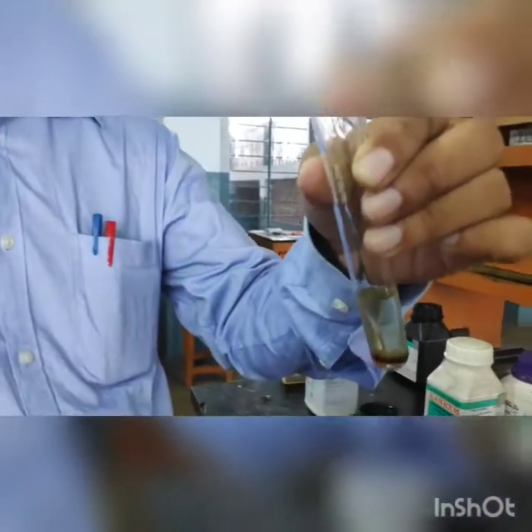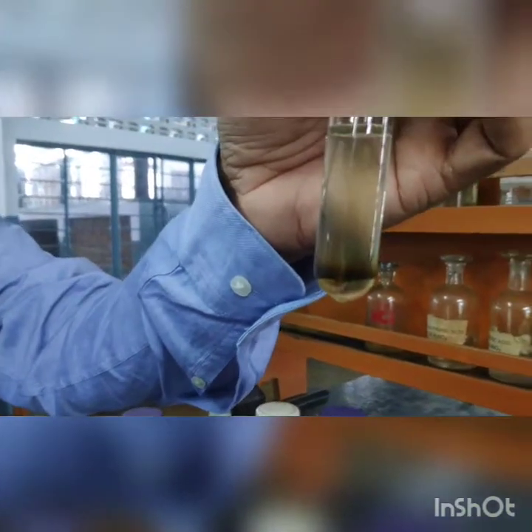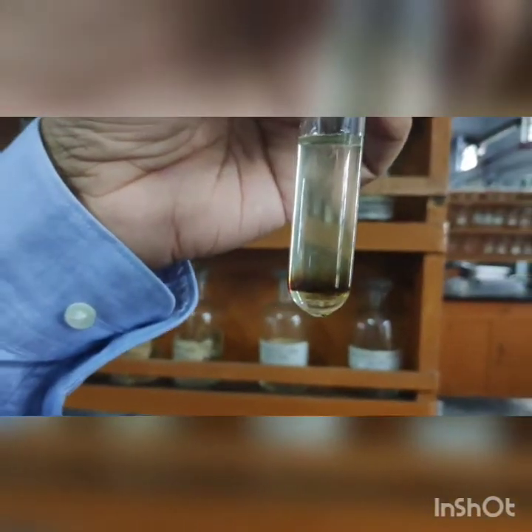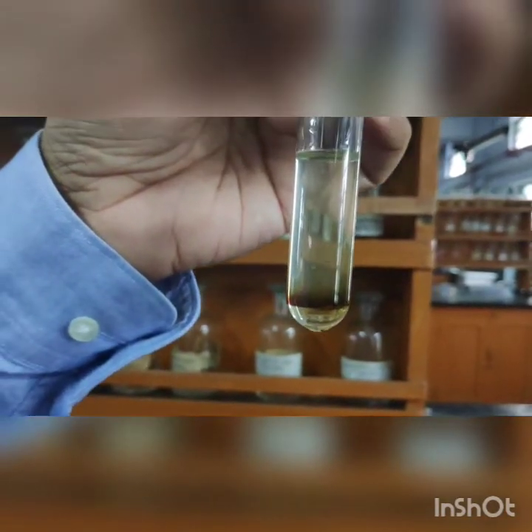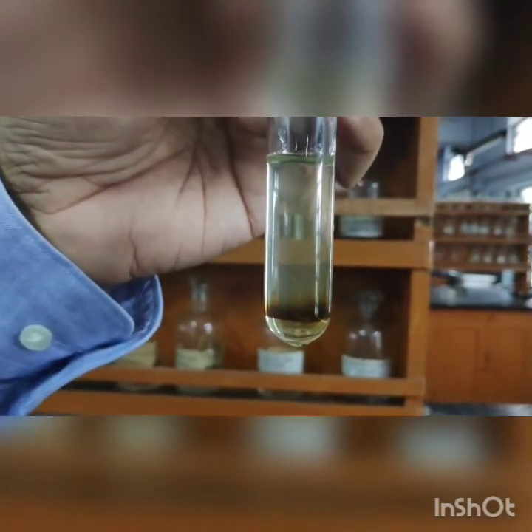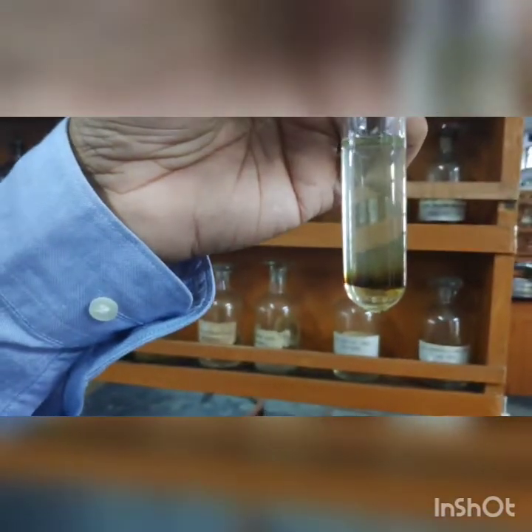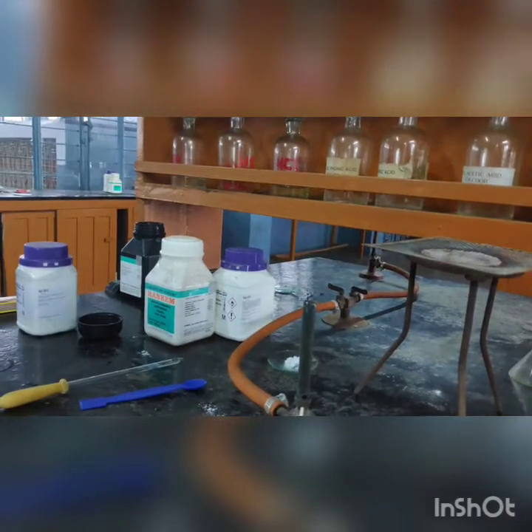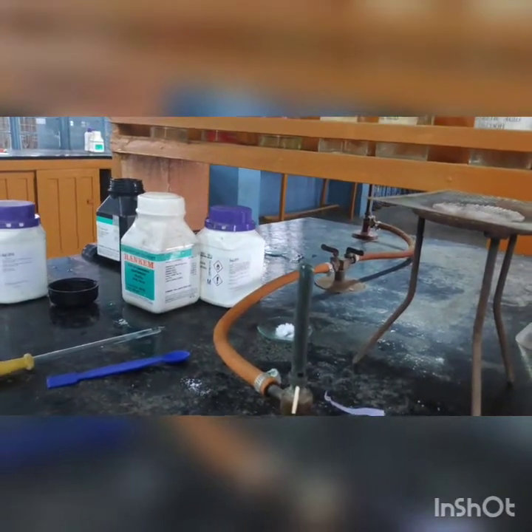A very clear brown ring has been formed at the junction of the two liquids — sulfuric acid being denser forms the bottom layer, and the ferrous sulfate and salt solution form the upper layer. Once this brown ring has been formed, we can very clearly confirm that the salt contains the nitrate ion.